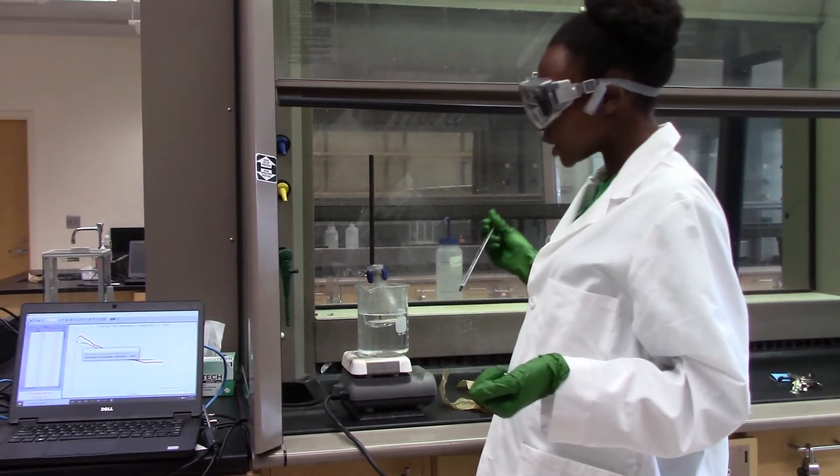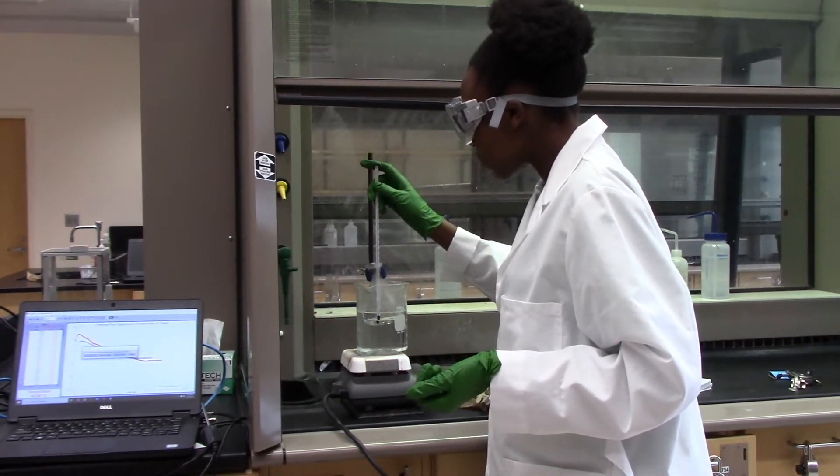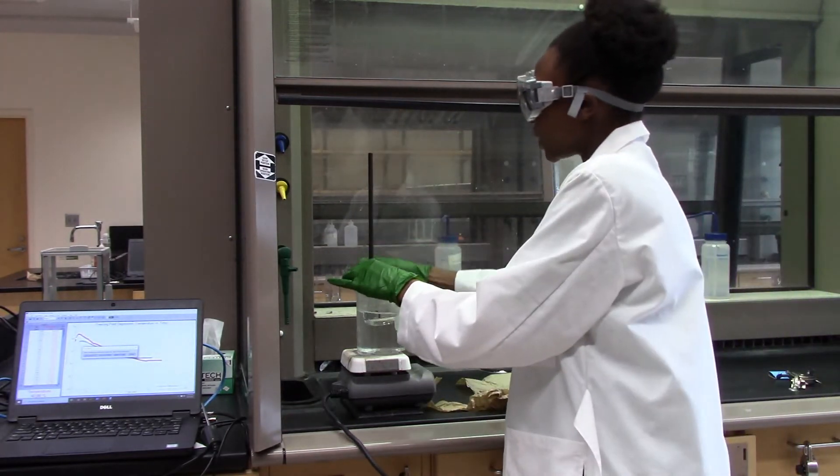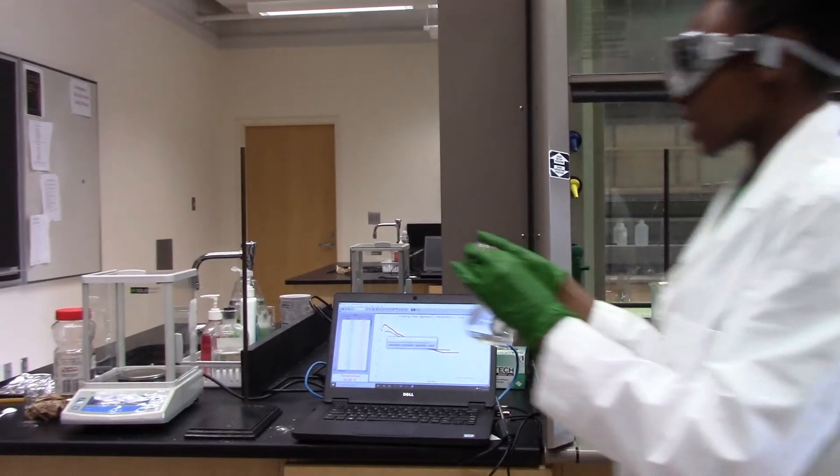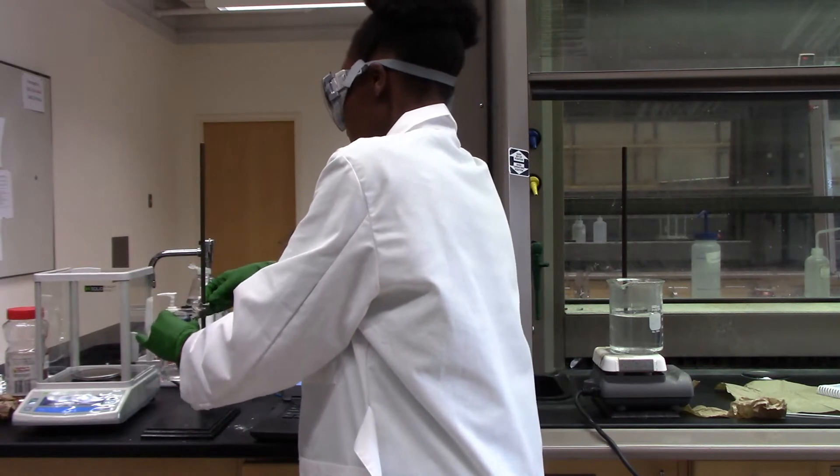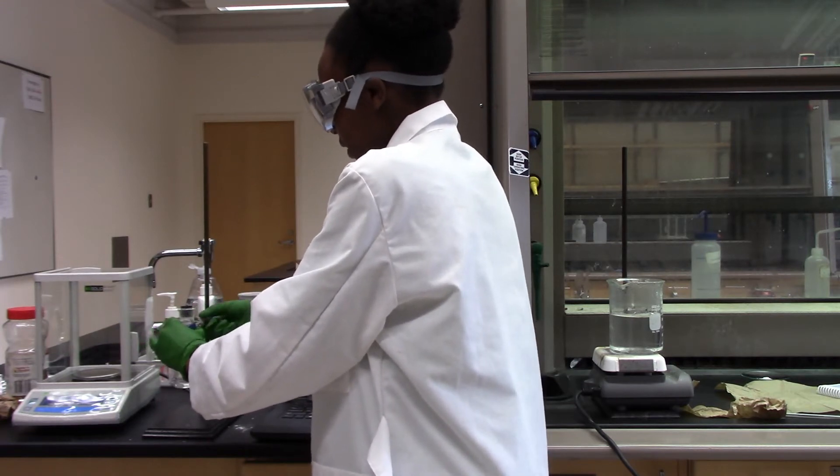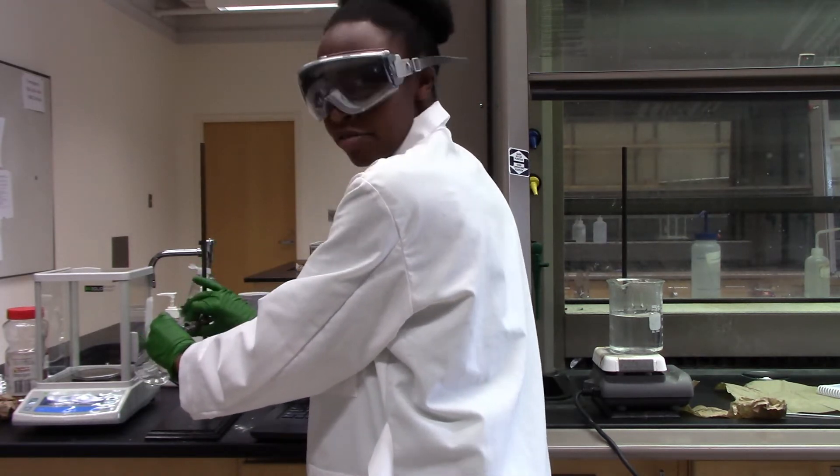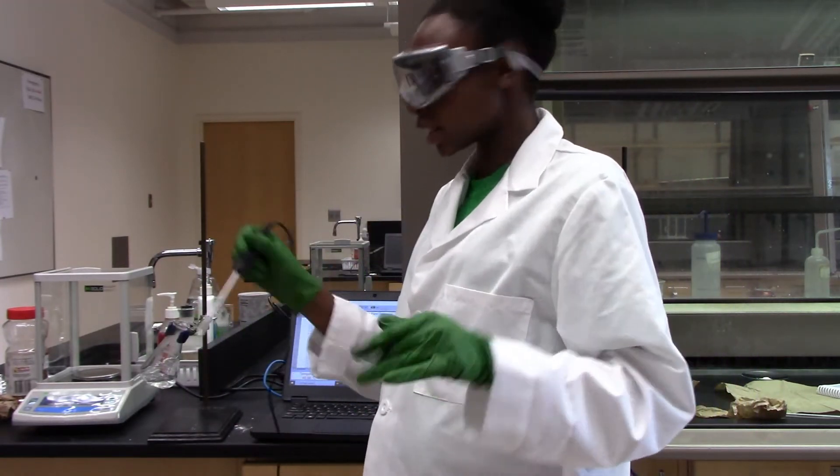Okay, so I'll check the temperature of my lauric acid. And I will say it's about 60 degrees Celsius. So I'm going to take it out and transfer it here. I'll keep my flask at an angle so that it's easier for me to insert the temperature probe and monitor the temperature change.